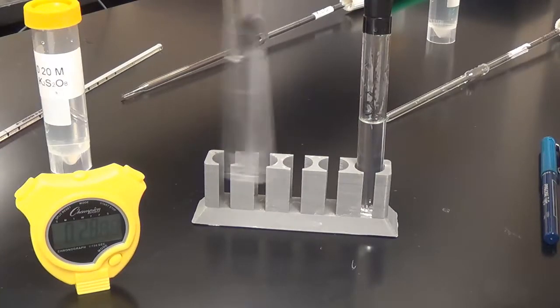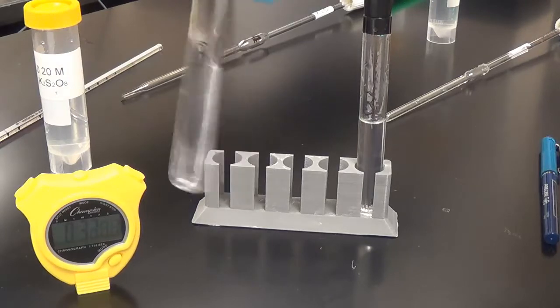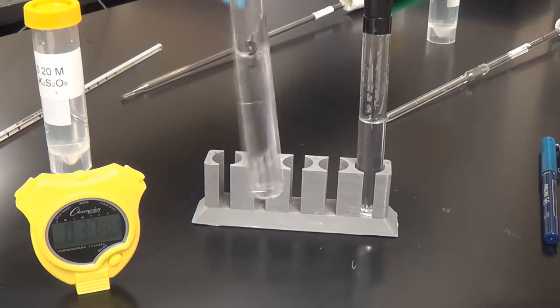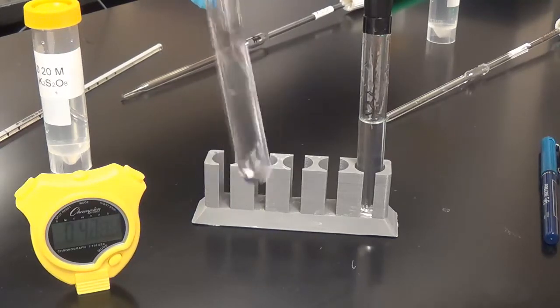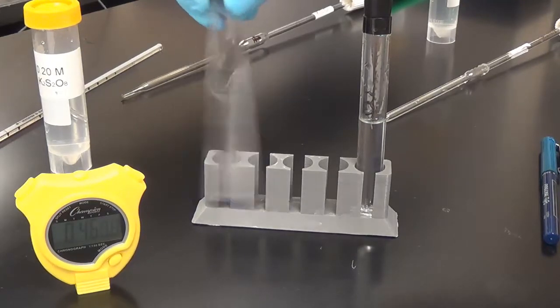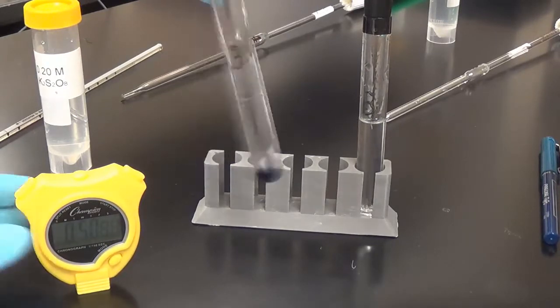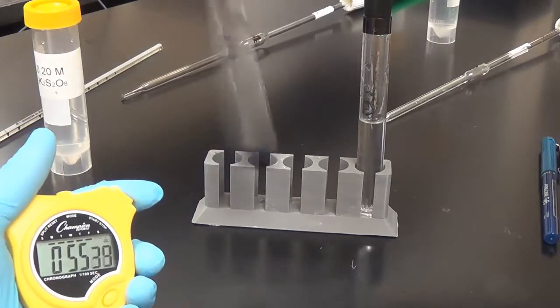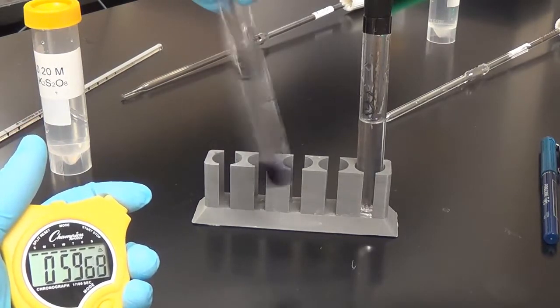So this potassium persulfate, experiment 1 we added 2 mils, experiment 2 we added 4 mils, the concentration is 0.2 molar, and now in experiment 3, this tube, we're adding 2 mils, but we doubled the sodium iodide. Okay, so it looks like some stuff is happening. Like I said before, we want this totally blue, and this is the first of our duplicate runs for experiment 3 conditions.